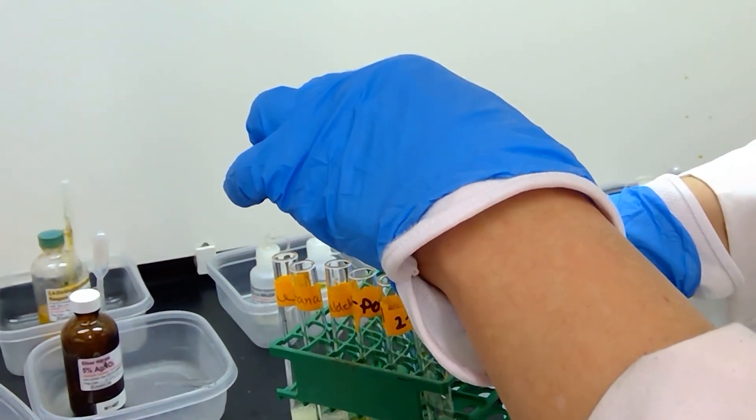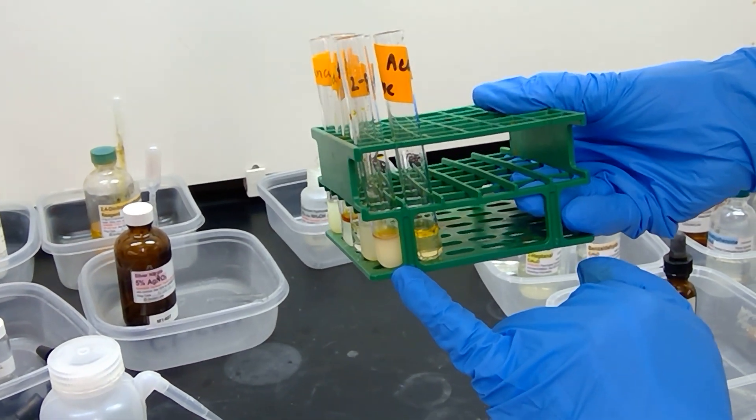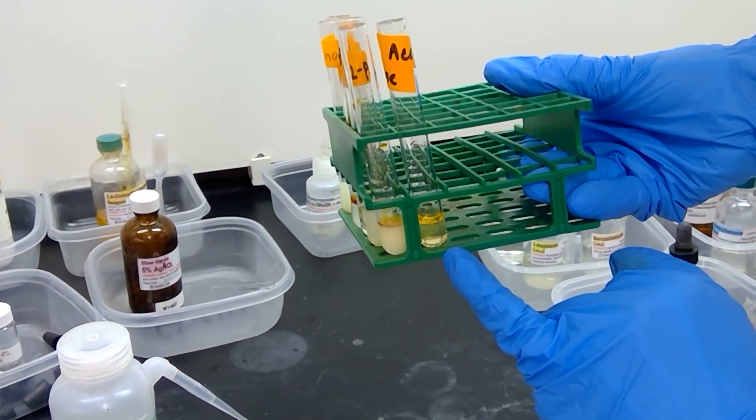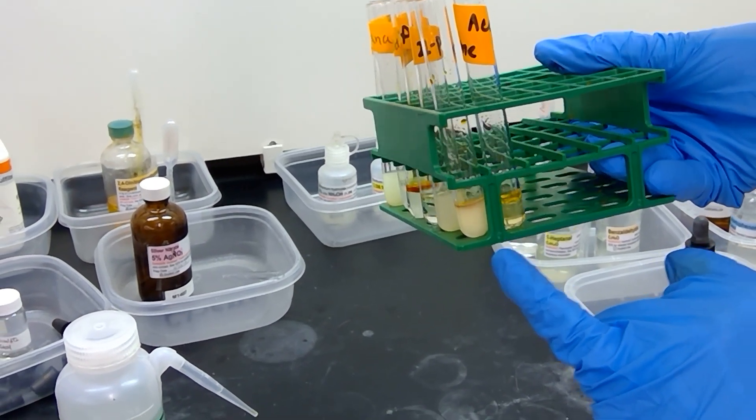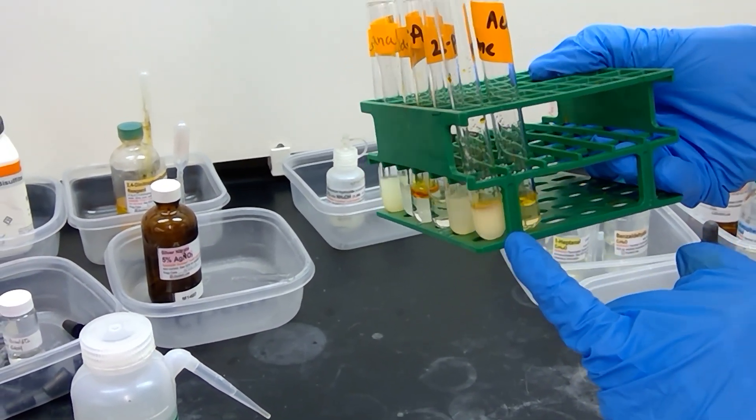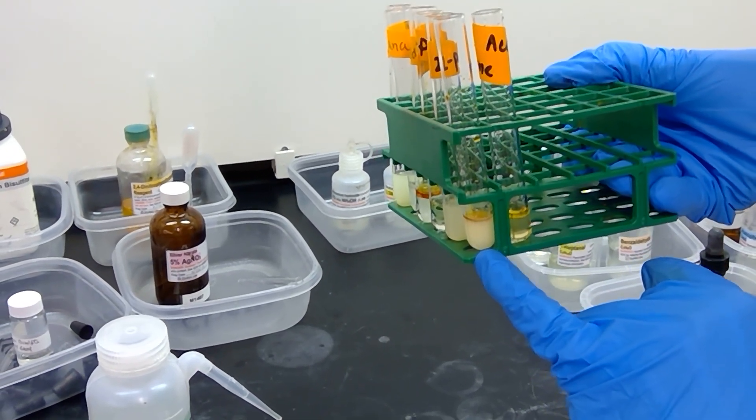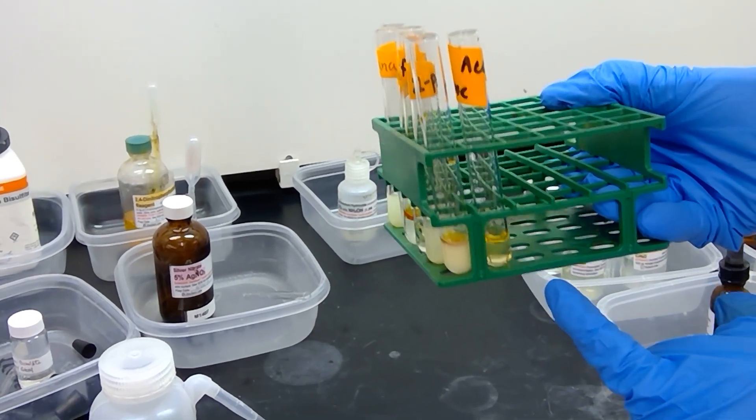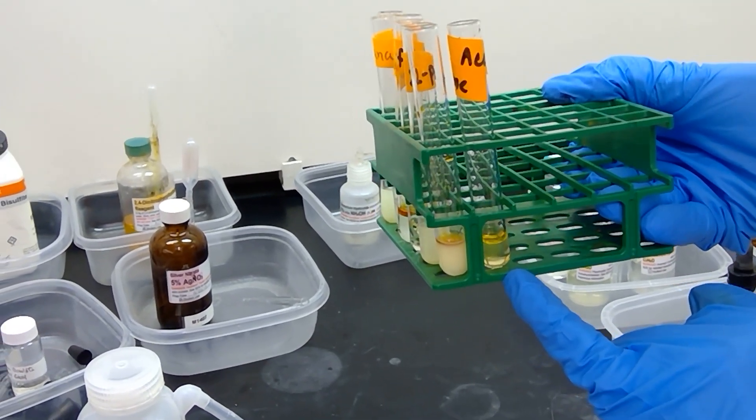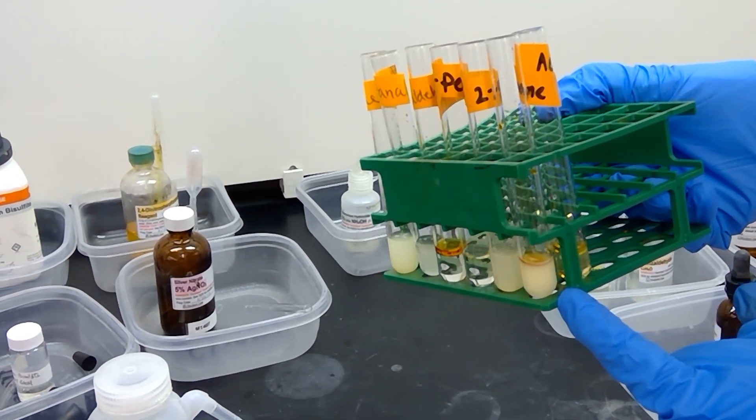I will put the two samples next to each other here. On the left is the water dissolved sample. On the right hand side is the 1,2-dimethoxyethane. What Lee is speculating is that the addition of the water is helping with the formation of the enol or enolate. In the case of the 1,2-dimethoxyethane, we don't get any assistance for formation of the enolate. That's why we do get precipitate when the solvent is water.